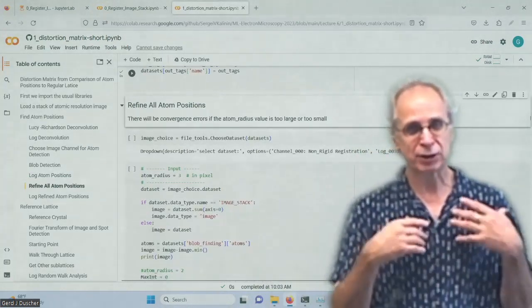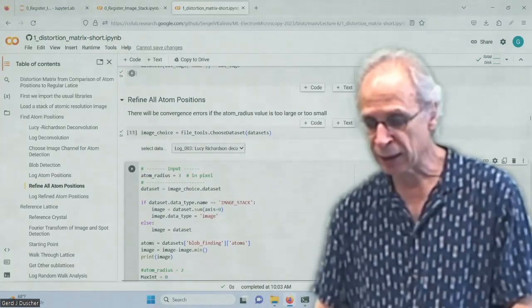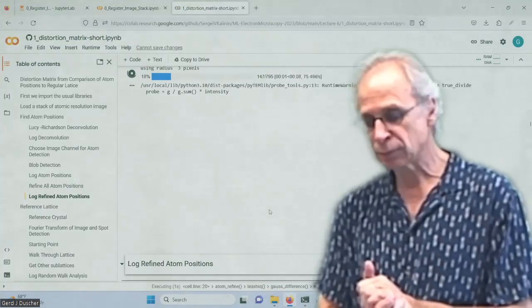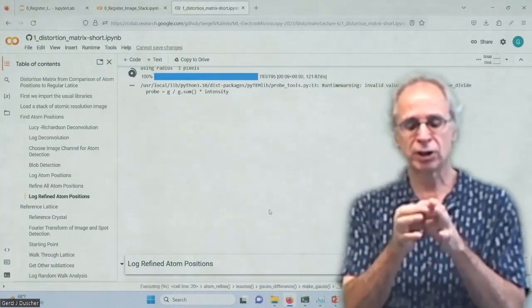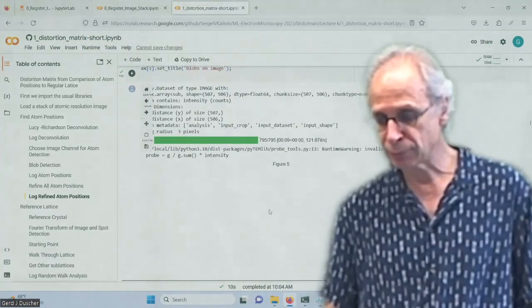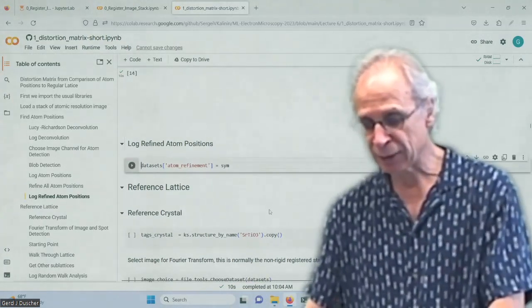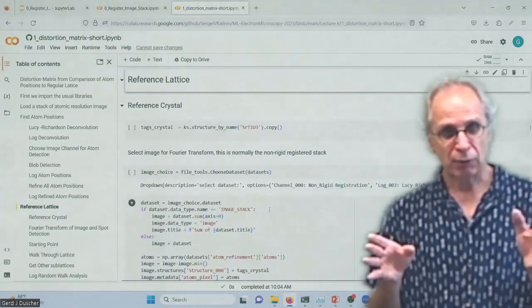And because we want to have sub-pixel accuracy, what we want to do now is fit an atom in there. And we want to do that on the non-rigid registered data set. So we fit a Gaussian into each of these atoms. We are using only the center part. And we have the atom refinement. So we found our atoms.